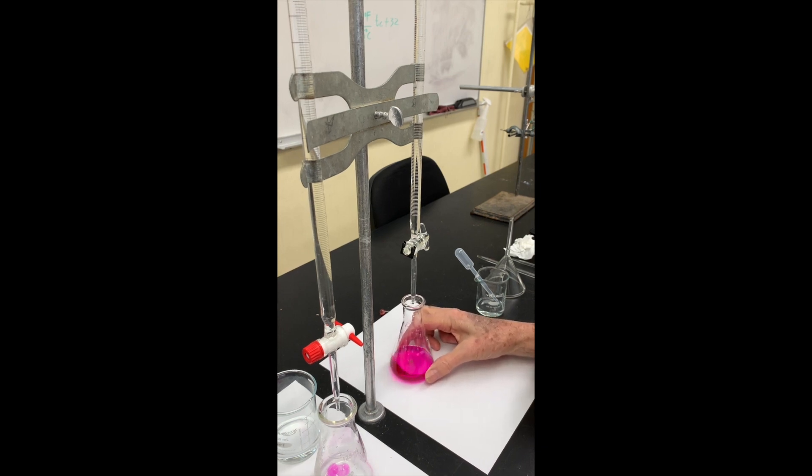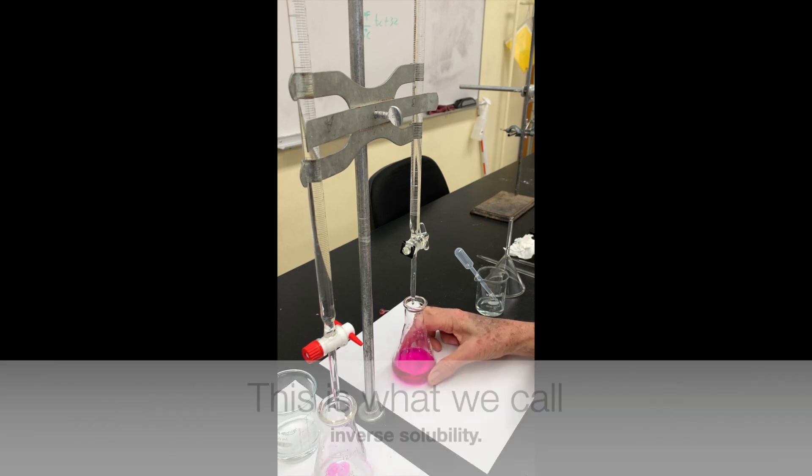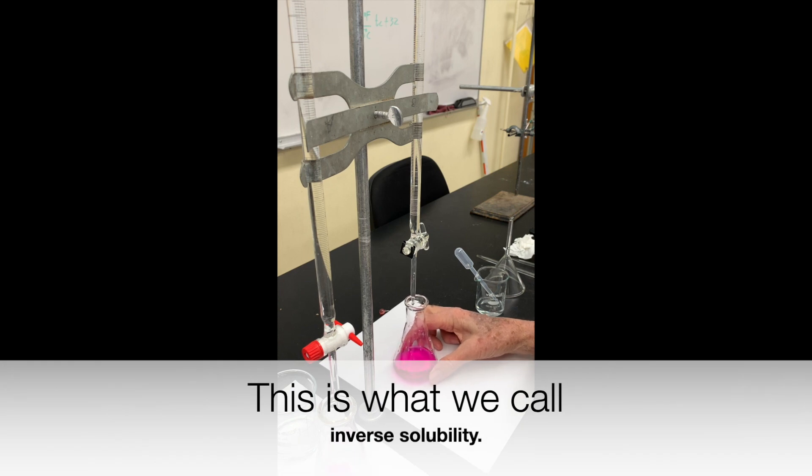If we have done a good job, the cooler temperature solution should be more soluble than the higher temperature. This is one of the things we have in chemistry called inverse solubility.